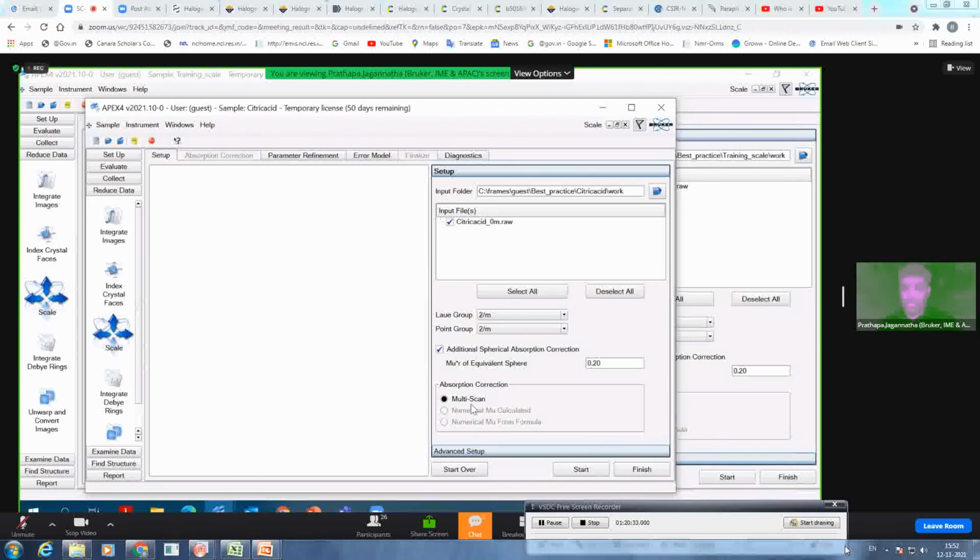And then in the absorption correction, you have a couple of methods. The multi-scan is SADABS, and numerical, mu from formula. It's not highlighted because this you can do only if you do face indexing. Otherwise, you can always do multi-scan. And 95% of the time crystallographers use multi-scan.